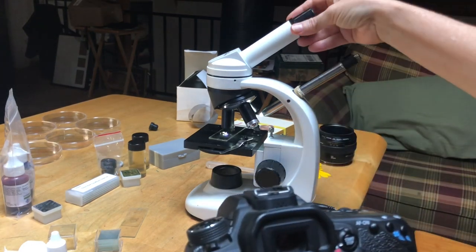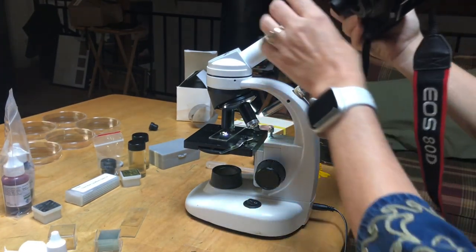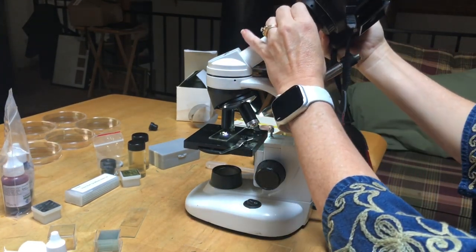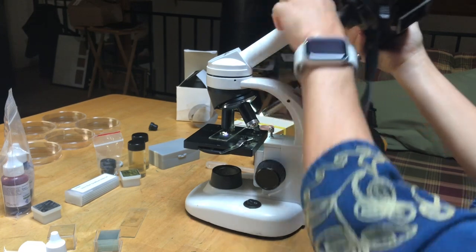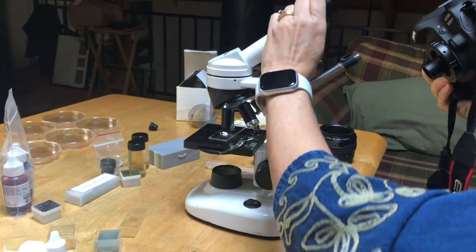I'm going to turn it this way because it makes me a little bit nervous. And then you can remove the eyepiece from your microscope and place this as the eyepiece in there.